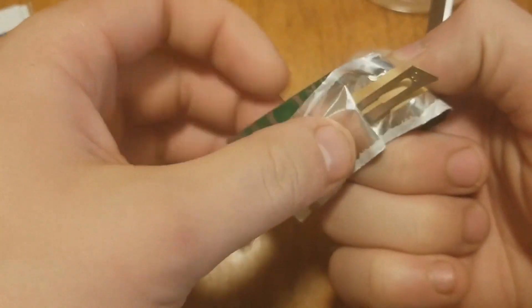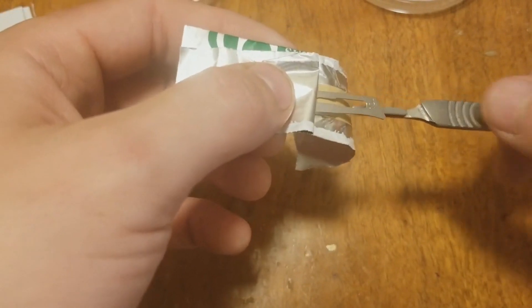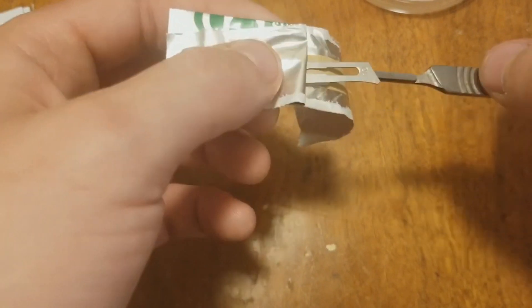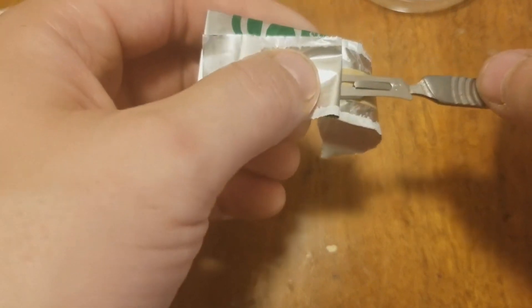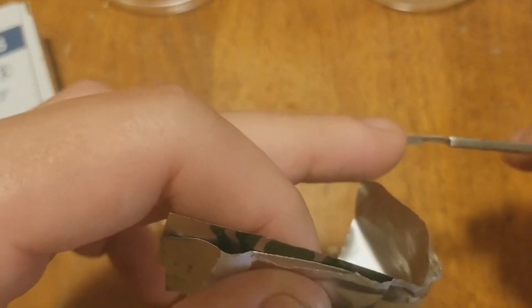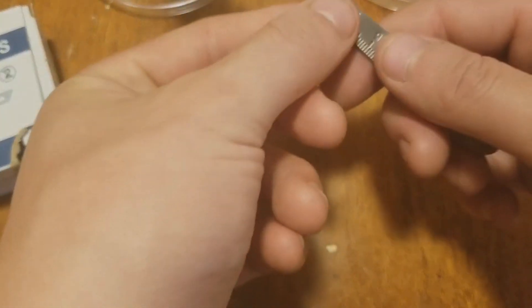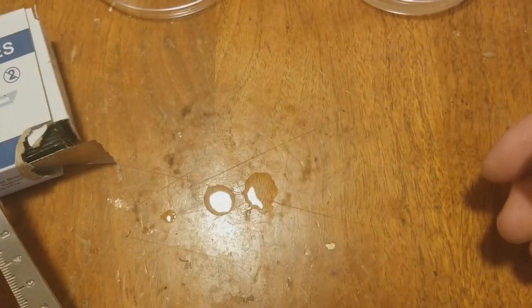There's only one way these blades actually go on. I recommend holding it like this — you can see this end matches up with that end. You put it through at the bottom and make it go up the middle — there's a little slit in the middle there. Push until it clicks, and then until I'm cutting I like to leave it just like that.